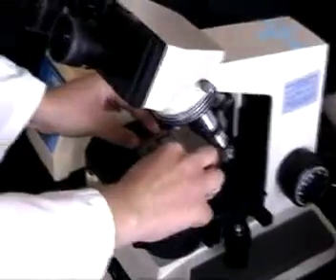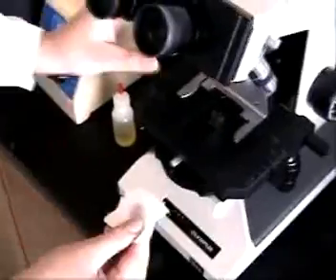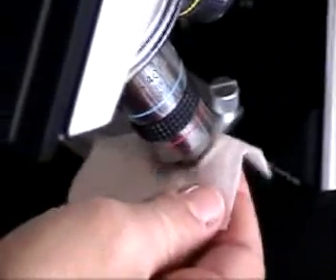Remove the slide from the specimen holder and you'll need to clean all of the objective lenses. Start by cleaning your 40x and 10x lenses and finish off with your 100x lens since it has the oil on it.